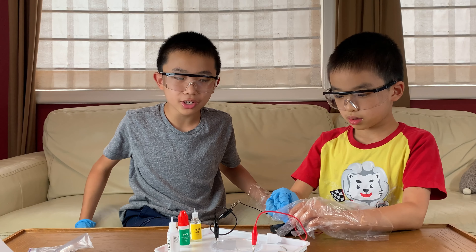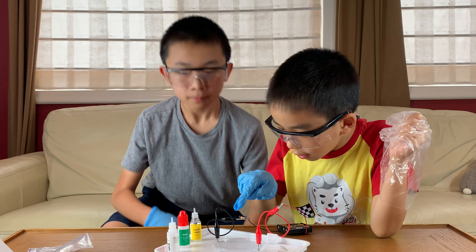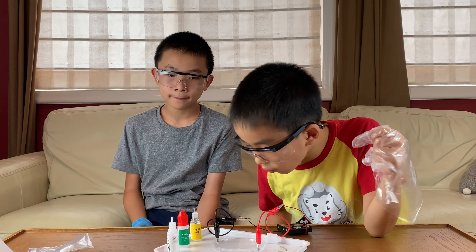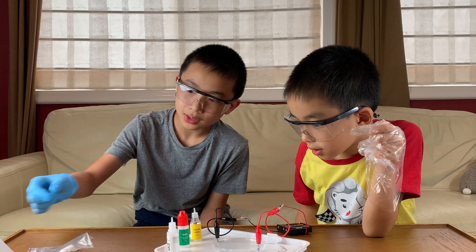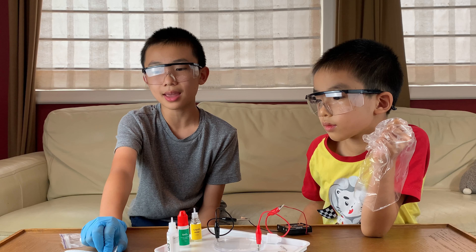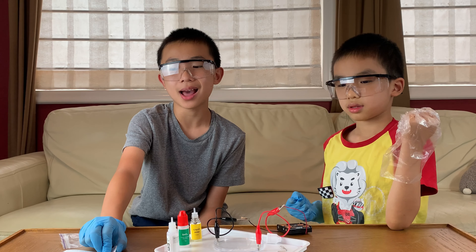This might be the moment the magic thing happens — don't get electrocuted! I can see part of the tree forming over here in the water. So finally, step five: the electrons from the batteries cause a chemical reaction, one of the products of which is metallic tin.